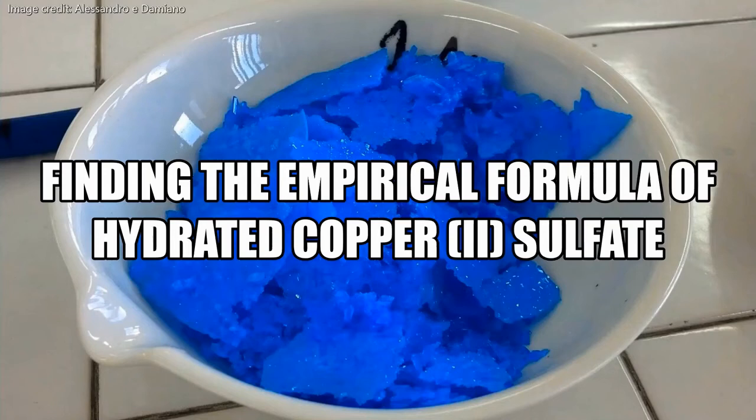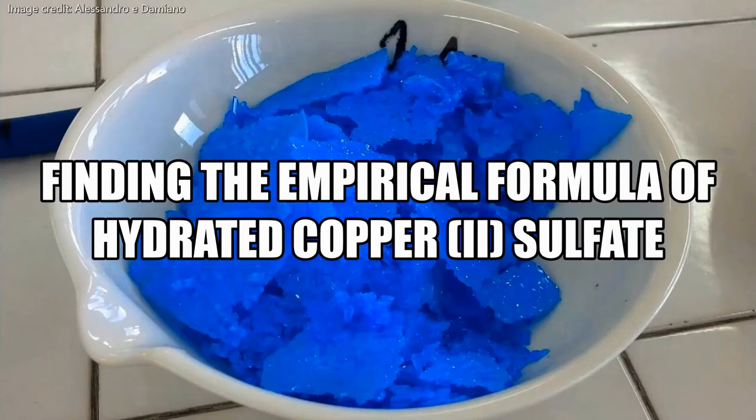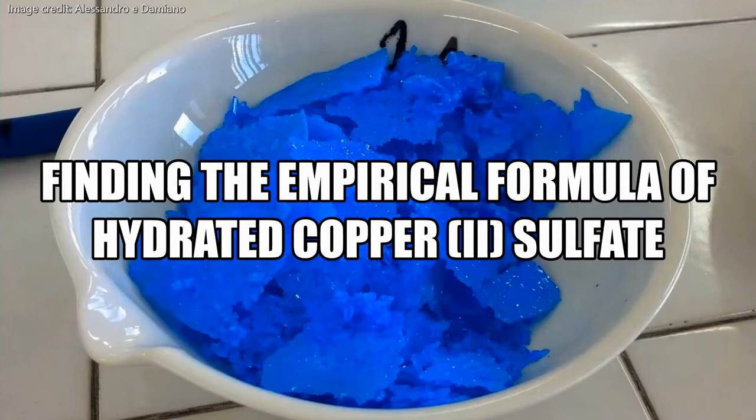This video discusses how to analyze data from an experiment performed to find the empirical formula of copper sulfate.